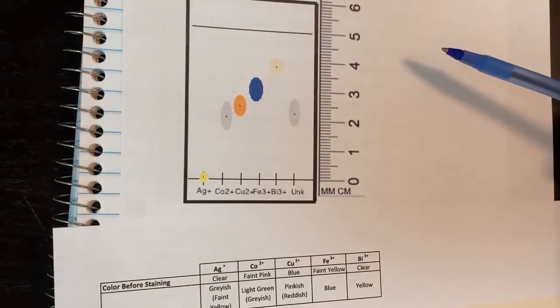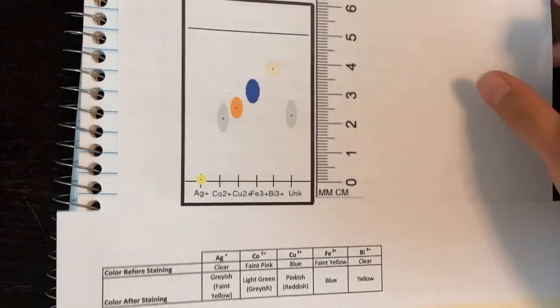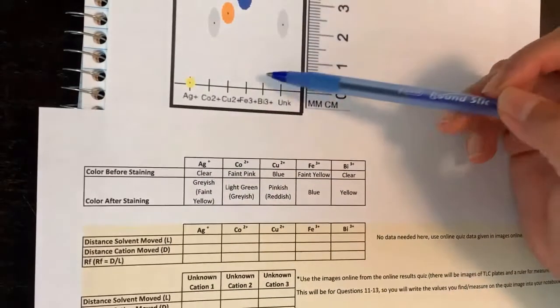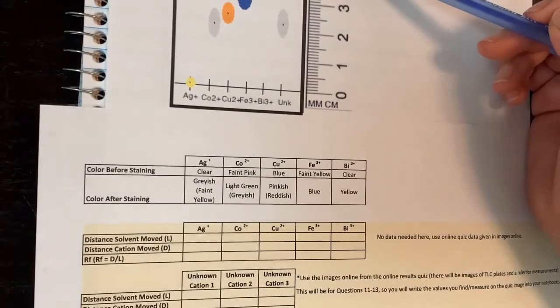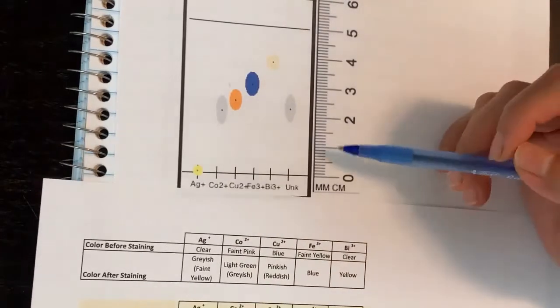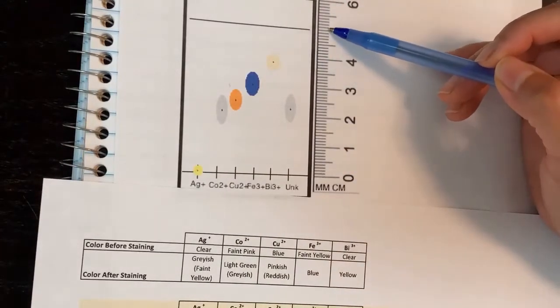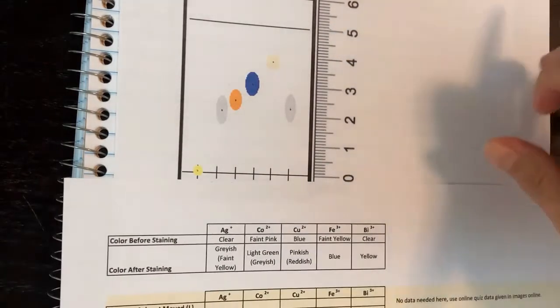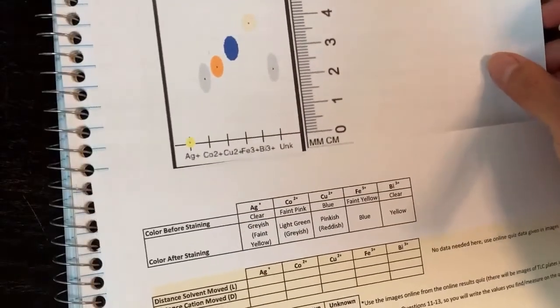To write down the values, you'll put this into your data, which is right here. I can tell from here to here all the way through it's going to be 5 centimeters. But again, on a ruler, how can you tell how many decimal places? On this ruler, this is 5.1, so I have to use 2 decimal places for sig figs. The ruler will be able to give you 2.